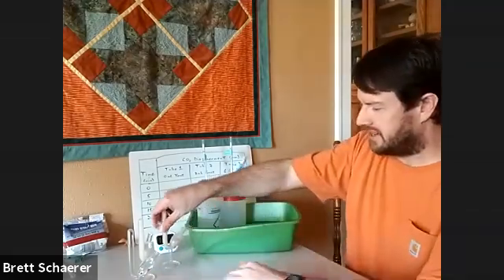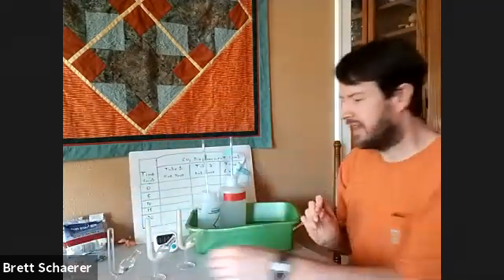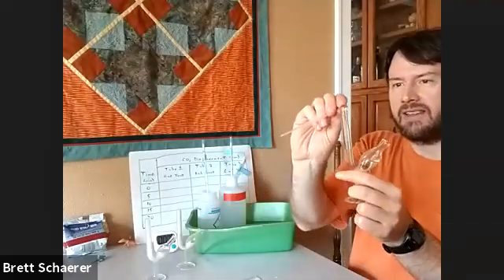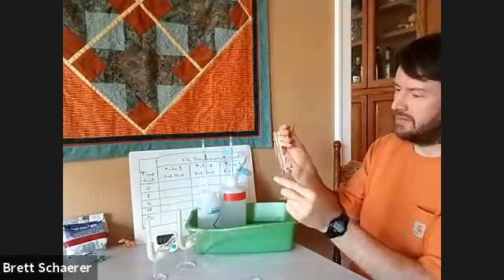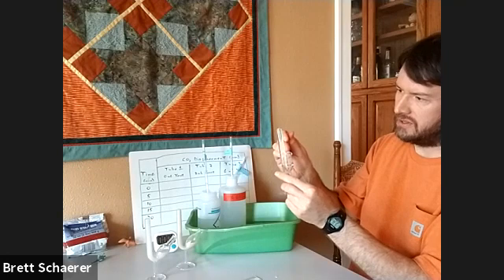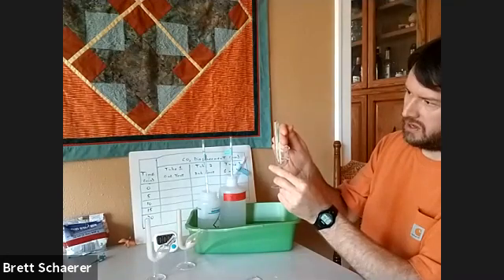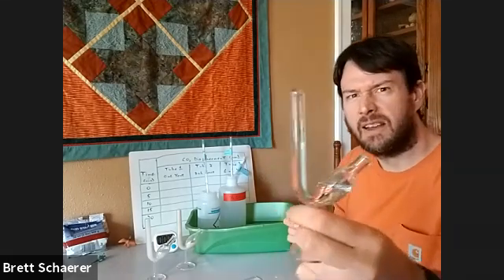Now all the tubes are ready to go. There's one more thing I want to do before we start this experiment. I'm going to use a transfer pipette and I want to get just a tiny little air bubble into the top of the tail of the tube, to give us a nice reference mark to measure. I'm just going to pipette in there and add a few air bubbles until they form a nice big air bubble at the top of the tail, like that.